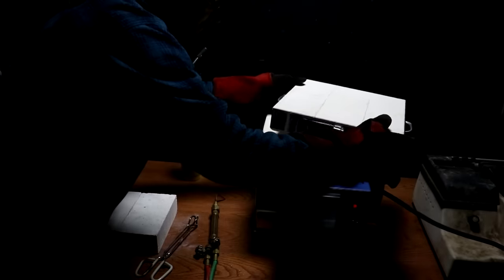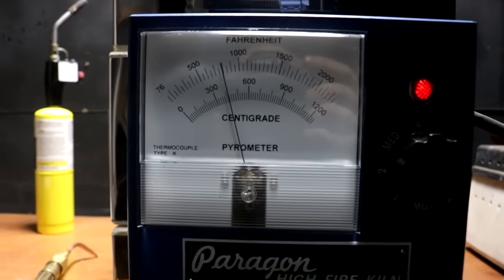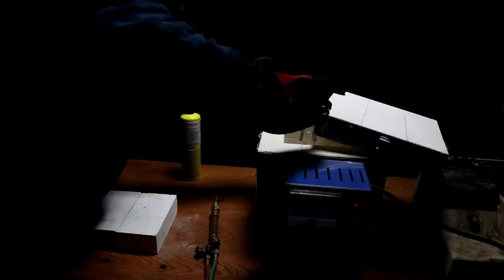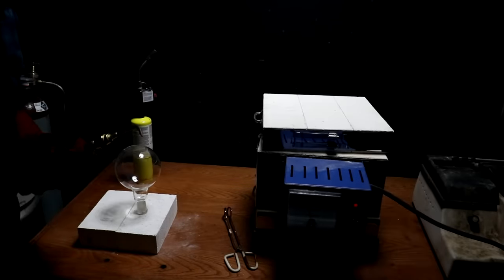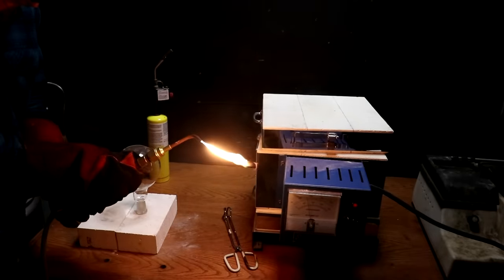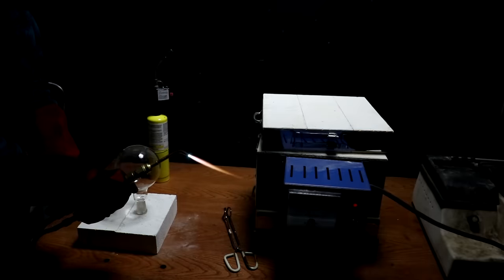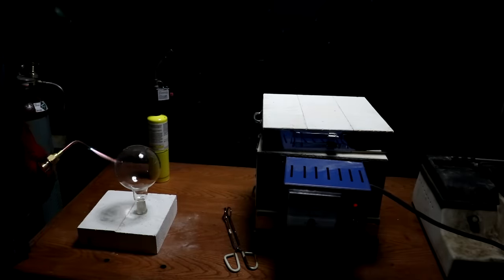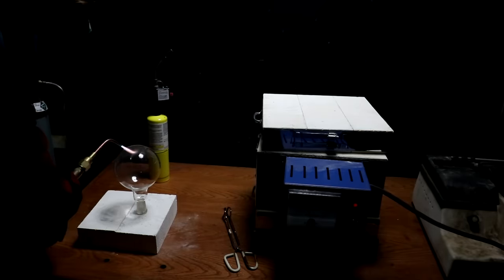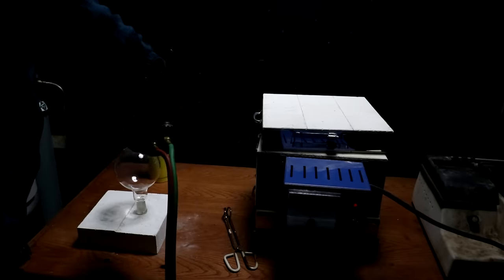Alright, so over the past little while, the furnace has come up to temperature. I'm going to pull out that flask. Let's see if we can weld it. Alright, start the torch. You don't need that big of a flame. Okay. Just gonna heat all over again.